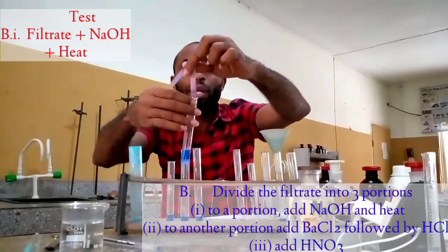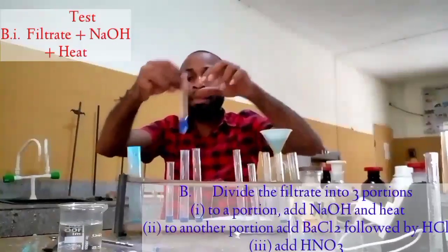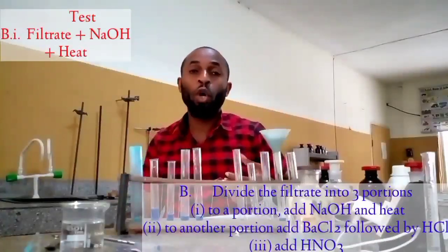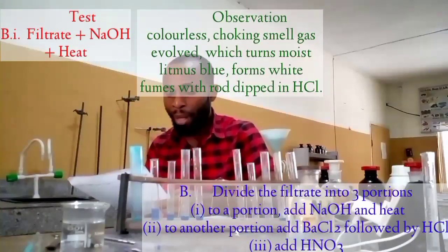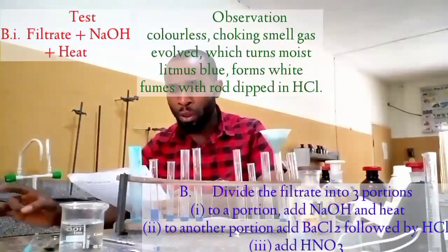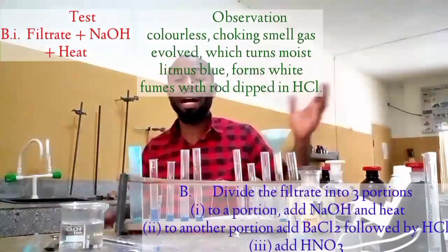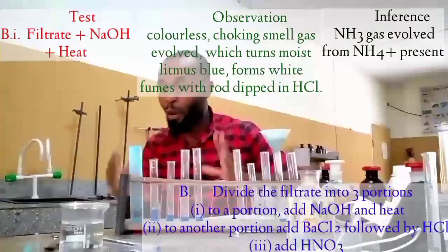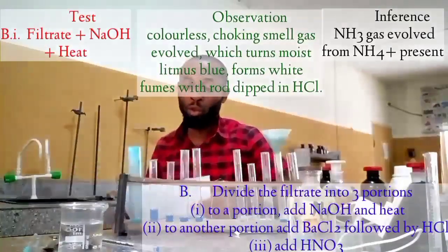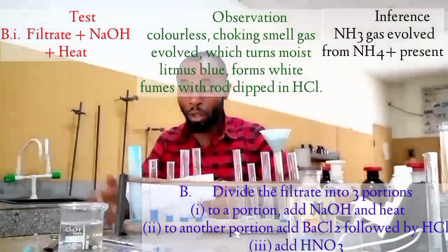This has been blue. Okay? This is blue. That means that you're going to have evolution of a colorless gas with a choking smell, which turns moist litmus blue, and gives white fumes with a rod dipped in hydrochloric acid. Now your inference is going to be ammonia evolved from ammonium present, as you can see on the screen. Remember that the first one has to do with adding water, as you saw. That is the first statement. This is the second statement.